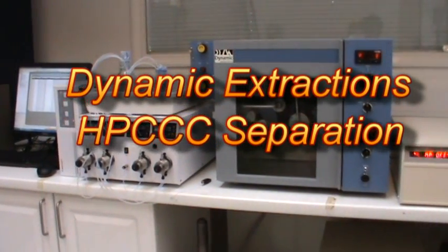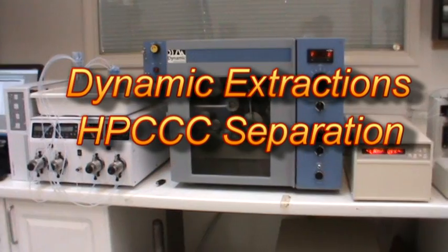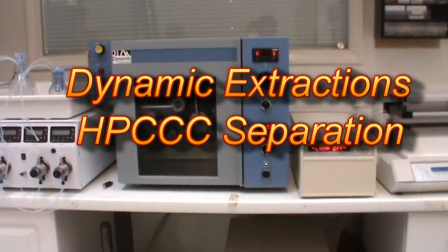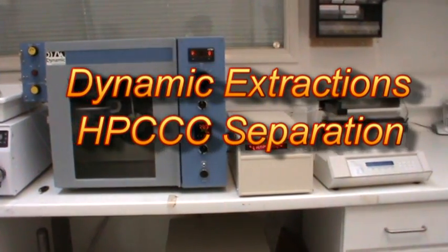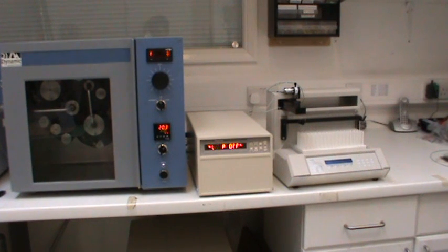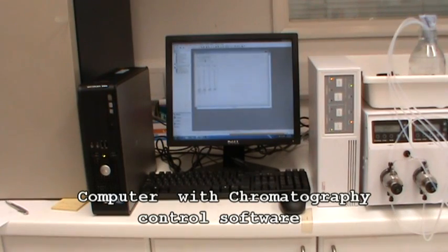Welcome to the Dynamic Extractions separation video. What you're seeing here is a standard HPCCC system setup. Let's look at each piece of the setup in turn.